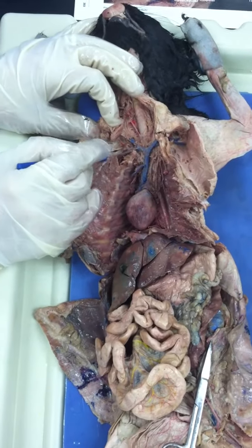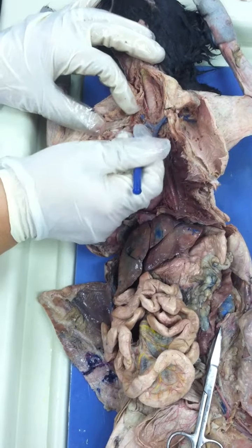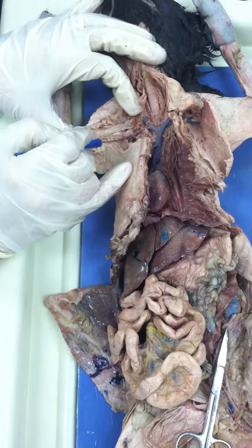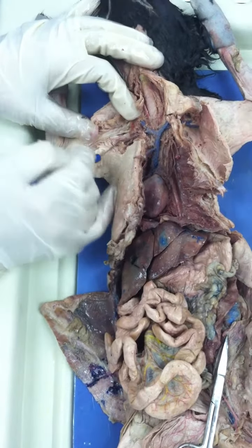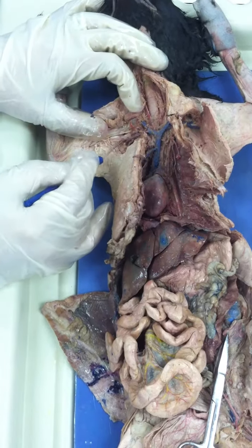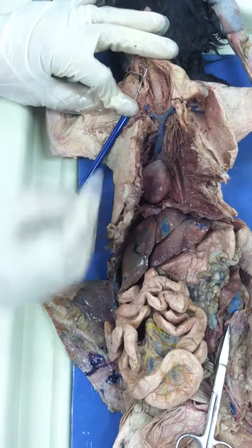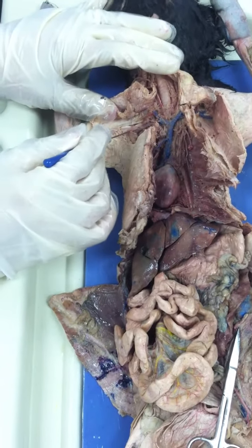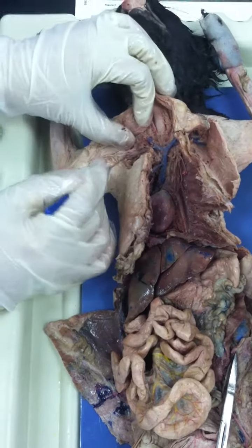Now, here we're going to encounter part of that subclavian, right? You see this? Now, the subclavian is going to give me a branch. You see it? Where do you see this going? Like the brachial? No. Axillary. And that's another thing you have to keep under consideration. You have to draw an imaginary line here so you'll know that this is the armpit, right? And then this blood vessel here is the axillary vein. You see it? Axillary. This one.